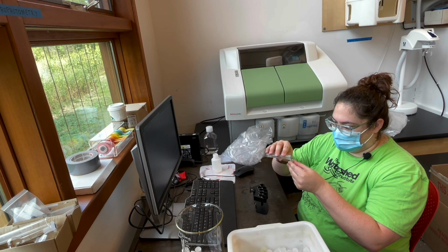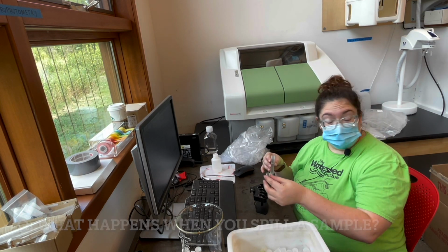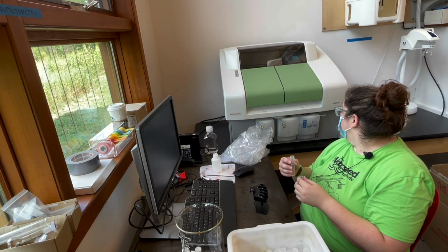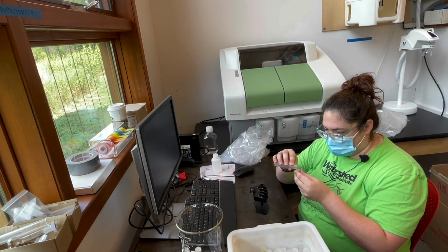What happens if you spill some of the sample? As long as there's enough to fill the cup, it's okay. And I'll just wipe it up with a cloth, which I usually have here, but I don't right now.